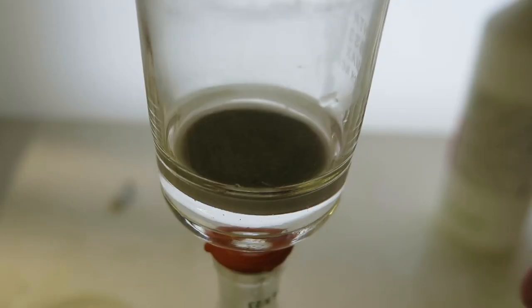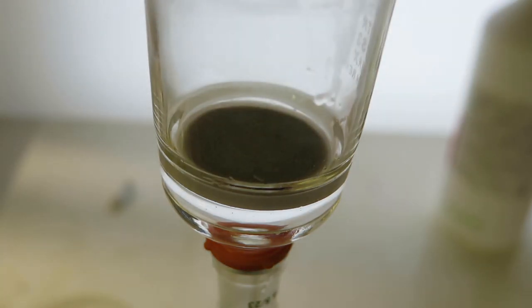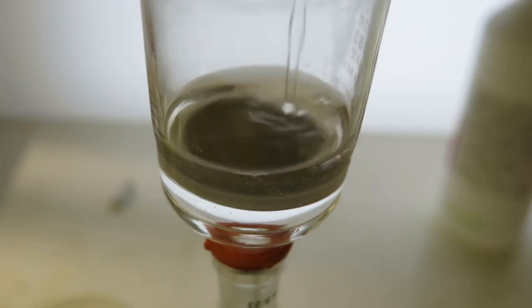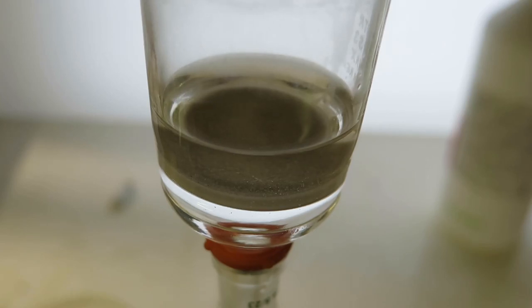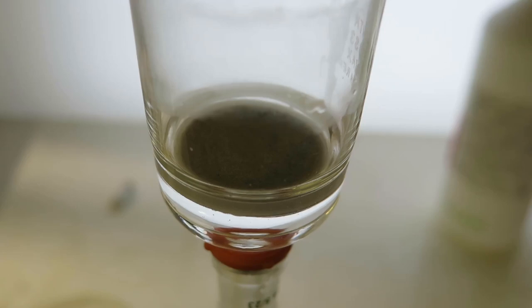The filter is still quite dark though, so there probably is still something. We'll add a little bit more of acid. Yeah, I would say that 99.999% has dissolved. The rest is whatever.